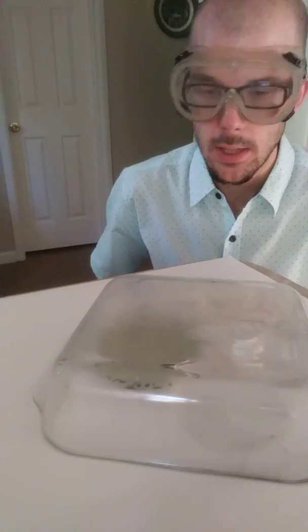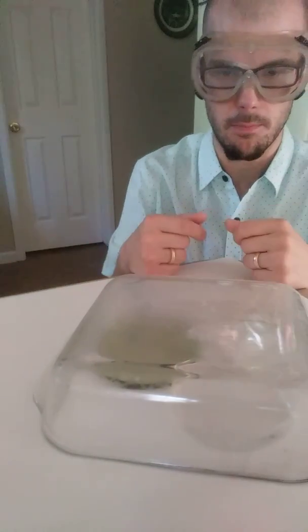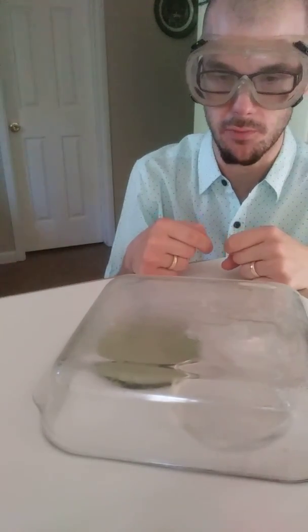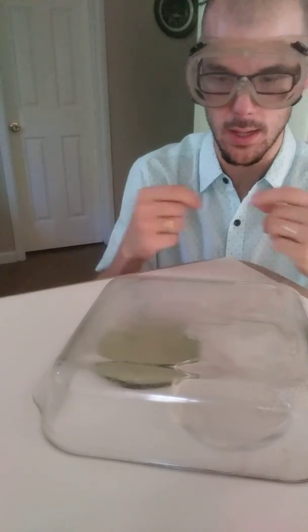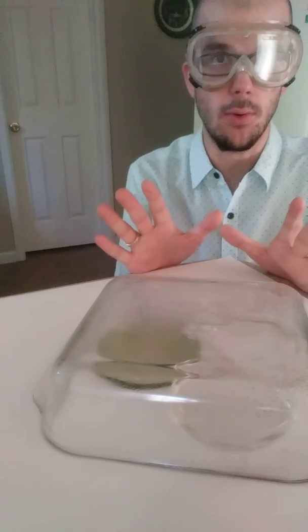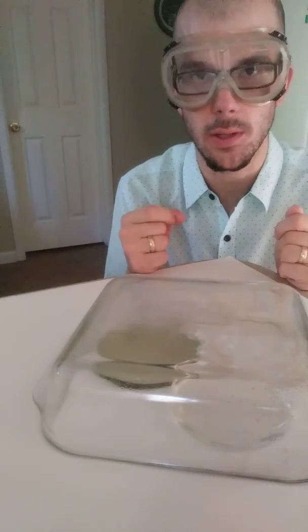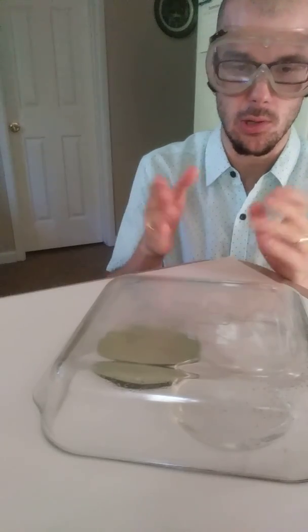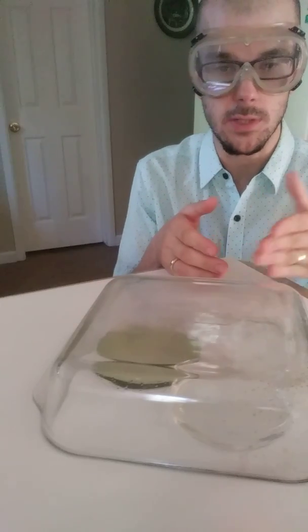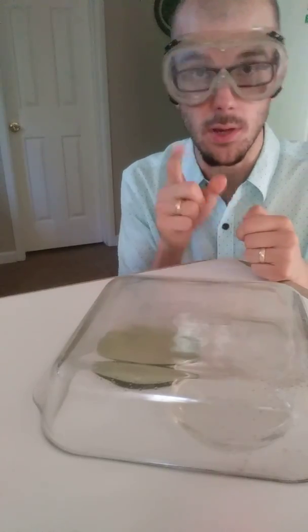Our flame has gone out and there's condensation that has formed around the inside of our pyrex dish. I use pyrex because it's really good for retaining its integrity in spite of heat. I'm going to let this sit for about 15 to 20 minutes — similar to the soda investigation — and we'll take a look to see if we observe any changes in the BTB or the ethanol.